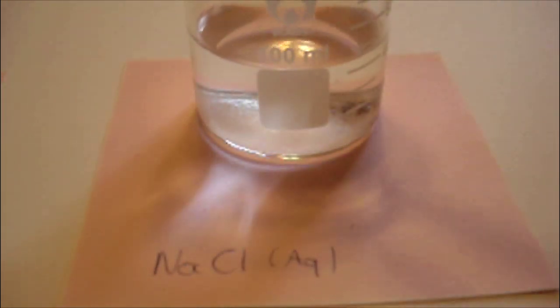Just do the same with the sodium chloride. I used about three spoons. Add into the silver nitrate solution the sodium chloride solution.